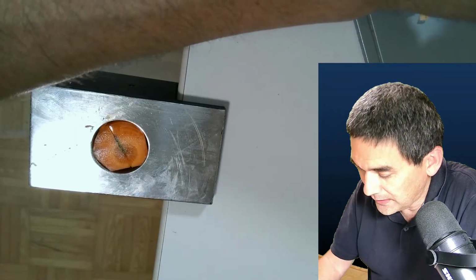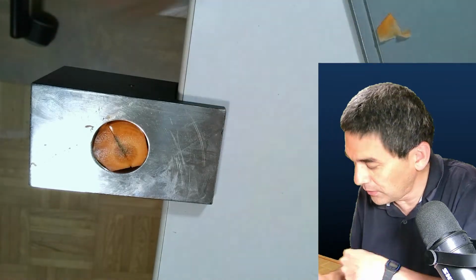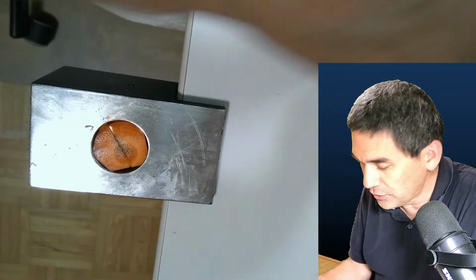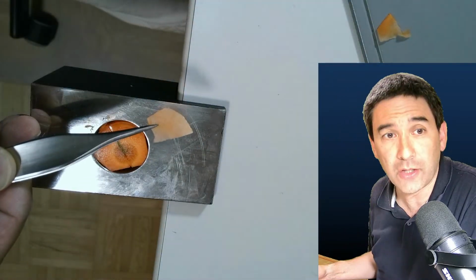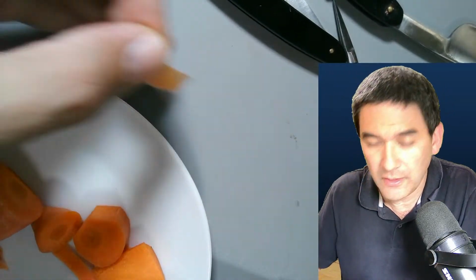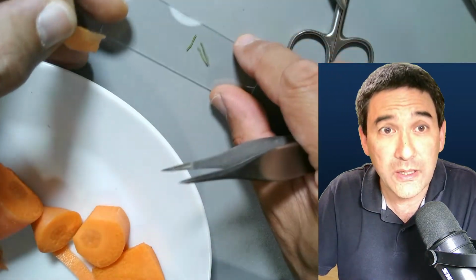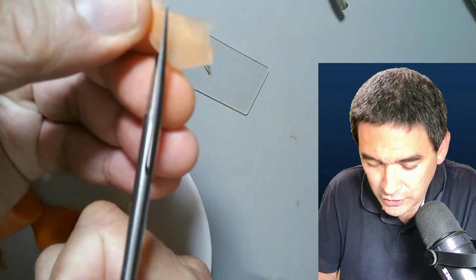Okay. And I've got now 3 cross sections here of the leaf, and you know what? Just for the fun of it, I'm going to also add one of those carrots here as well. Let me quickly cut off a small piece. So here are the 3 little ones, and then let's also put a small section of the carrot as well.